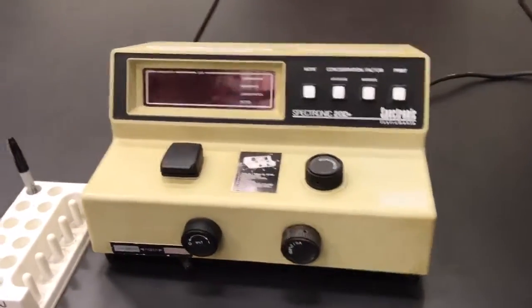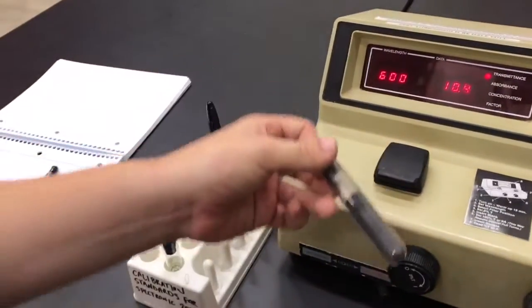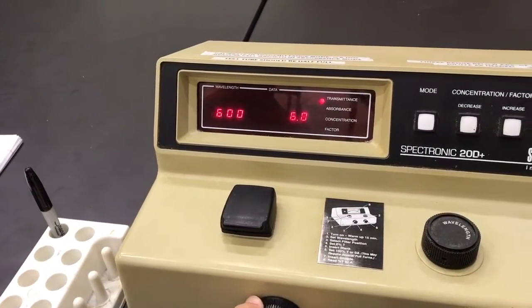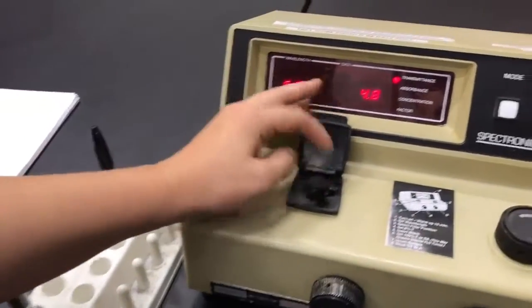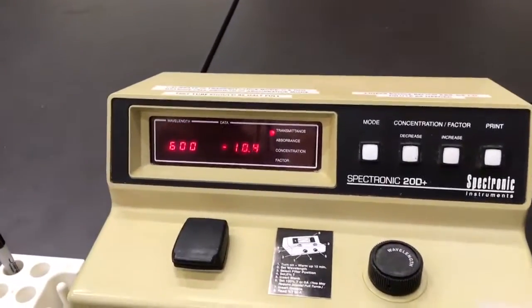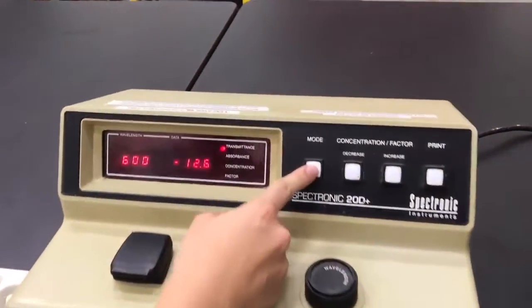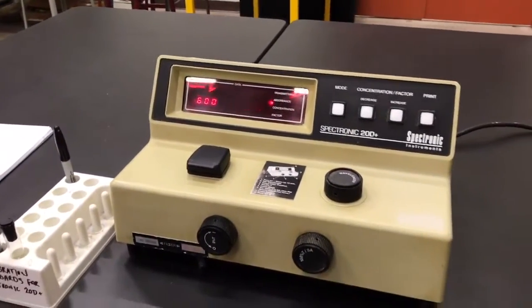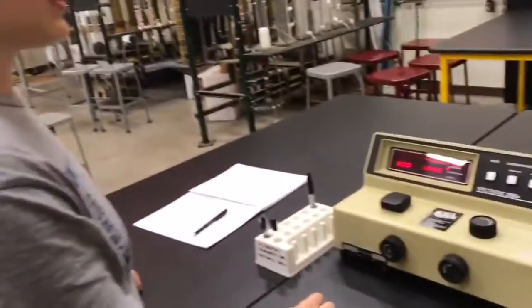To measure growth rate, use the spectrophotometer. First calibrate it for 0% and 100% transmittance: place calibration standards in the chamber, set the wavelength to 600 nm, and use the black to adjust transmittance to 0%, then use water to set transmittance to 100%. Once calibrated, take samples of your yeast media every 20 minutes and measure absorbance. If absorbance is above 1, dilute the solution until it reads below 1. Ensure each sample is properly mixed before measuring to guarantee homogeneity.